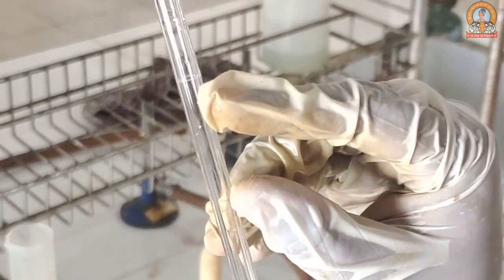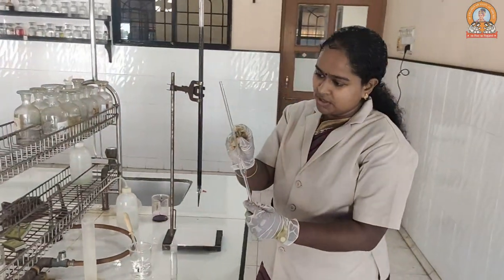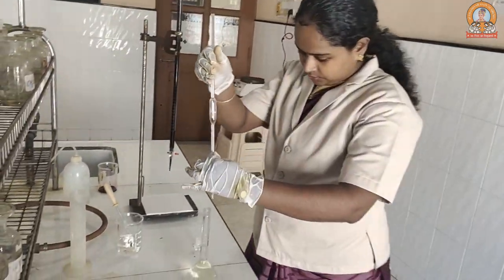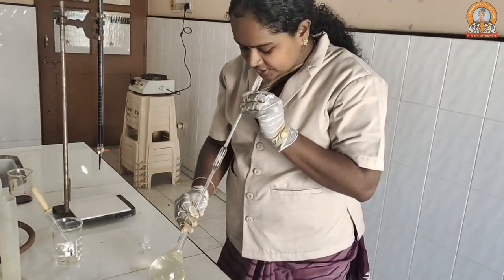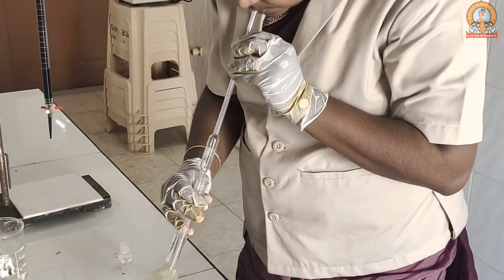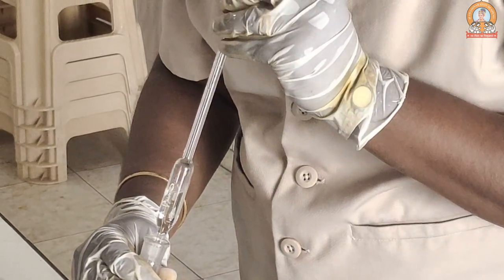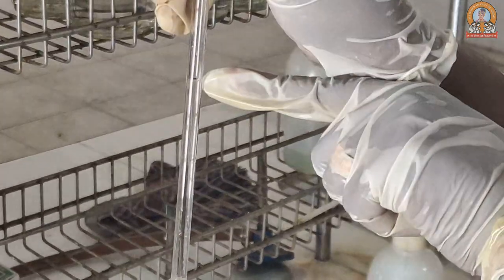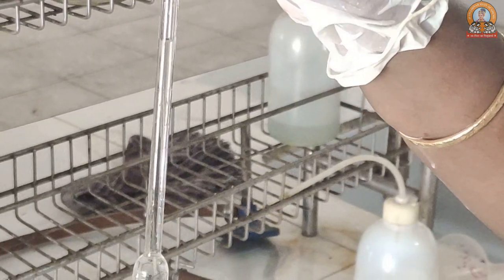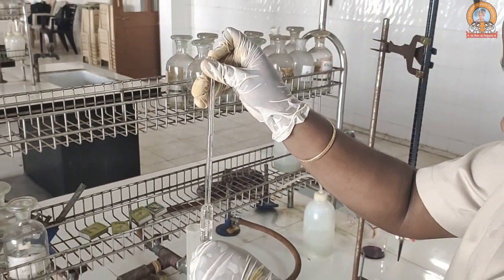This is our 10 mL pipette and this is the 10 mL calibration mark. We have to bring our solution just above it so that the lower meniscus touches the calibration. By removing your index finger carefully to allow air passage, you can bring the level down to the calibration point so that the lower meniscus just touches it.